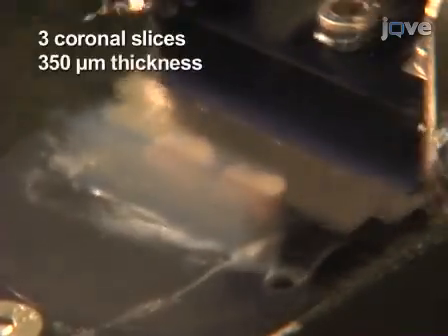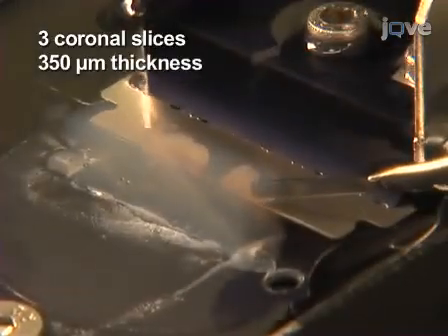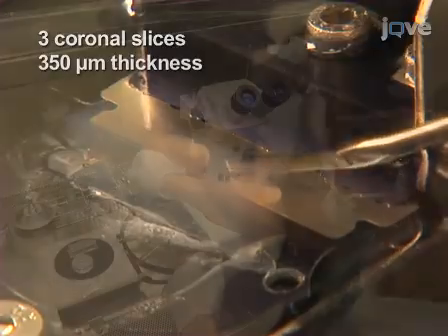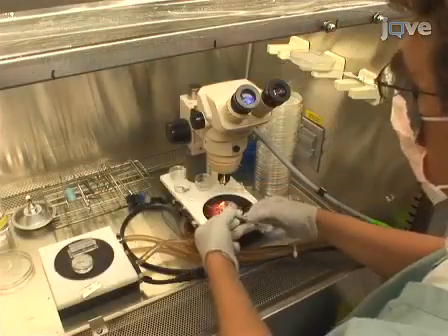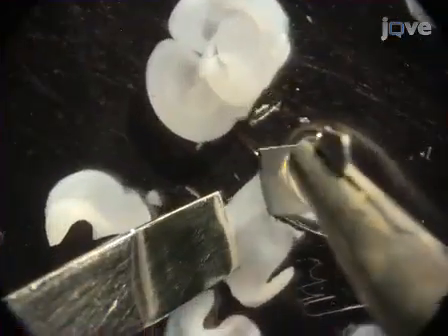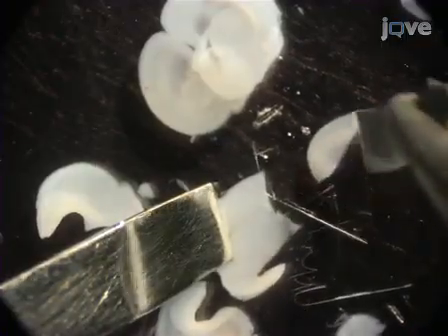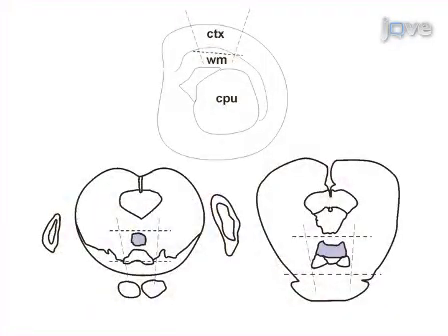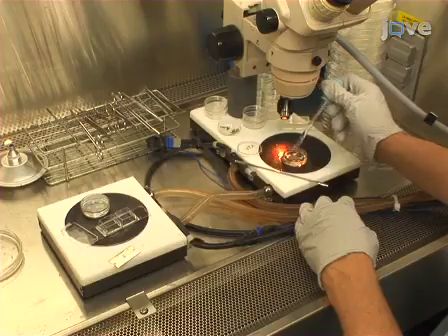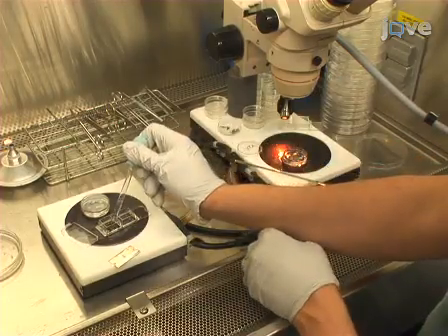Collect about 3 coronal slices of 350 micrometer thickness starting at the level of the striatum. Now, using a micro-knife made of broken razor blades, dissect about 2 mm wide coronal sections of frontal cortex and midbrain areas containing the VTA under a stereo microscope. Collect the tissue sections separately in small dishes filled with chilled Gey's solution.